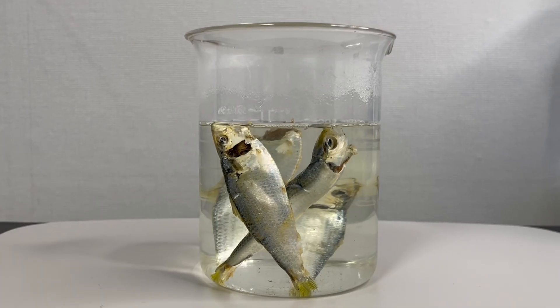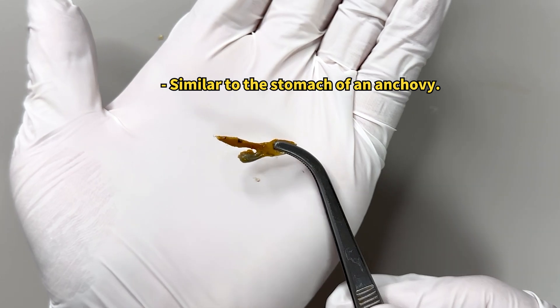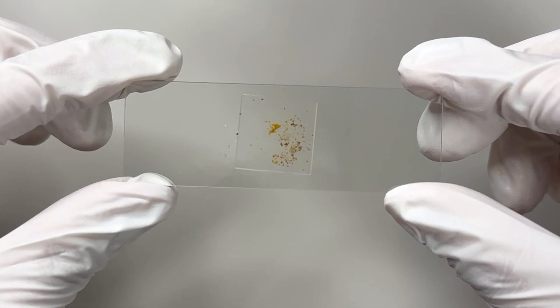The dotted gizzard shad is treated similarly — soaked in water, its stomach located and emptied.